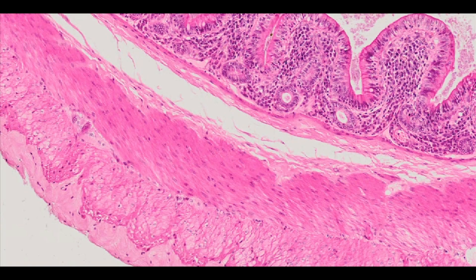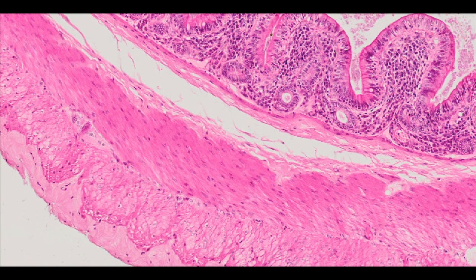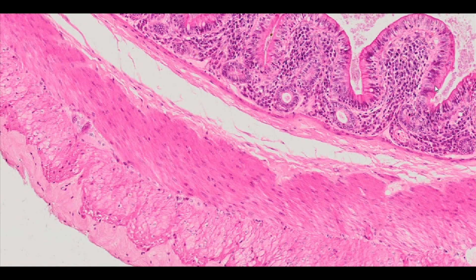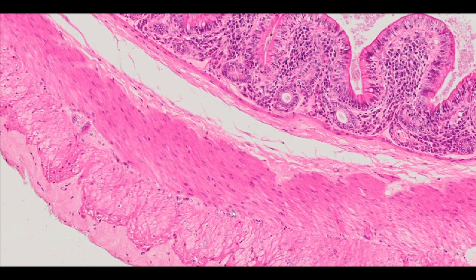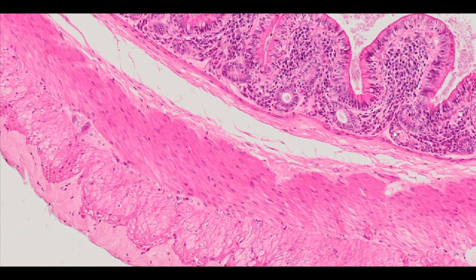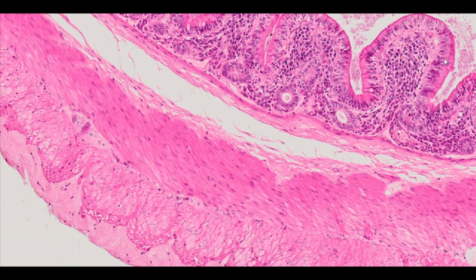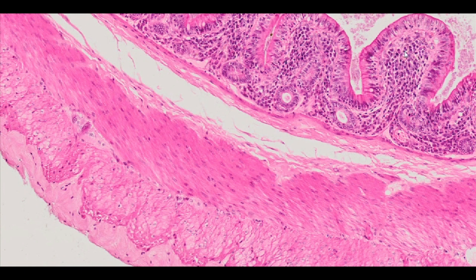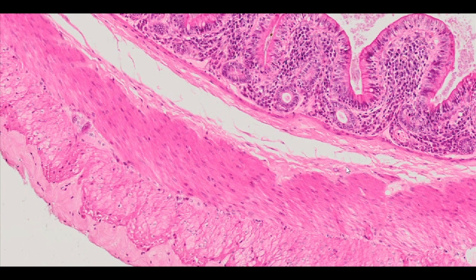Smooth muscle: transverse and longitudinal sections, H&E staining. The presented specimen shows the histological structure of the small intestine. The cross section shows the characteristic composition of gastrointestinal tract layers: mucosa with epithelium and lamina propria, sub-mucosa with loose connective tissue, muscular membrane, and serosa.